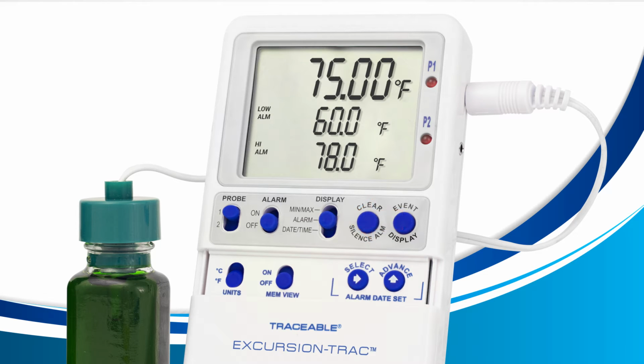Once you do this, your LCD will change to show your current temperature at the top, the low alarm in the center, and the high alarm at the bottom. The alarm limits are the low and high alarms. Now that we know the alarm limits, let's learn what the high and low alarms are.